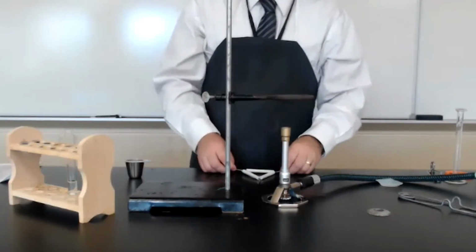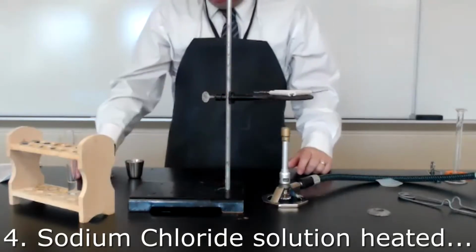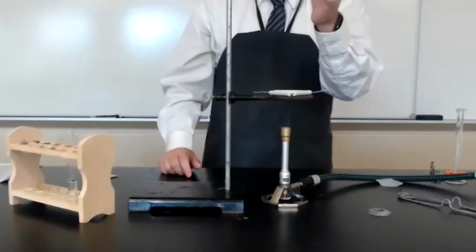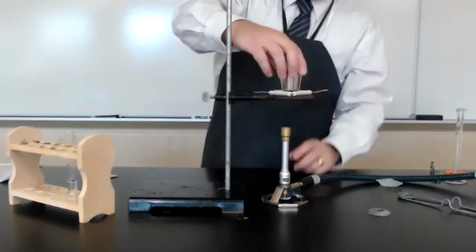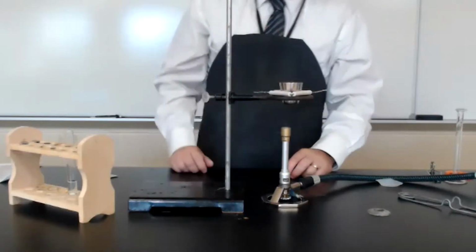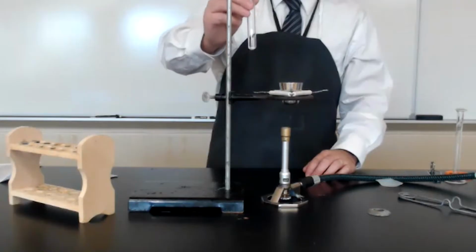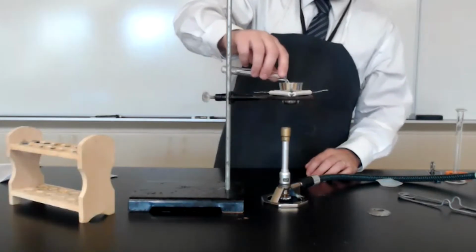On top of that, we're going to put a clay triangle. That's going to hold our crucible. So a crucible is like a cup. It could be made of ceramic, or it could be made of metal like this one is. So we're going to sit the crucible in the clay triangle, and then we can transfer our sodium chloride solution that we just mixed up into our crucible.